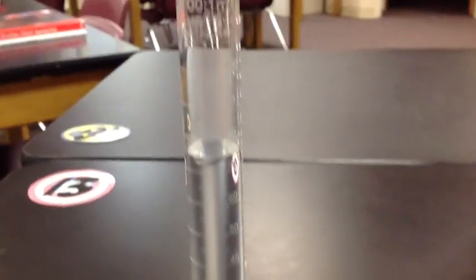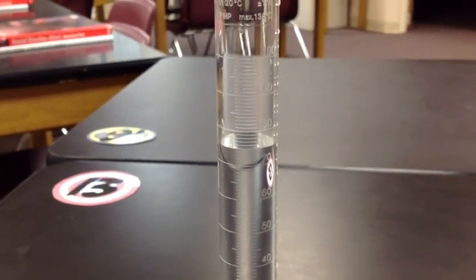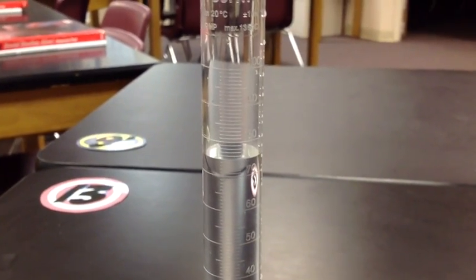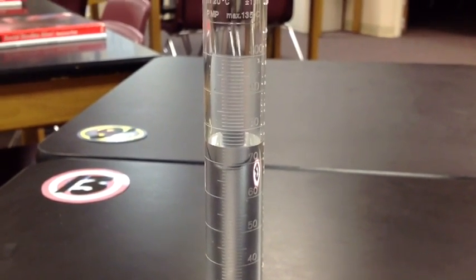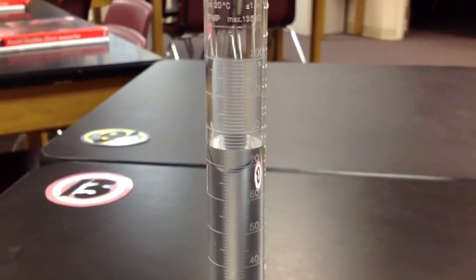What I'm going to do is I'm going to place my object in the water. The water level should go up, and then I subtract the two numbers to get the volume of the object that the water was displaced by. So let's take a look over here.